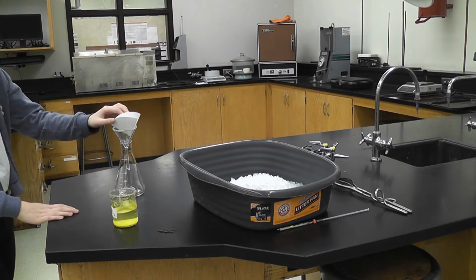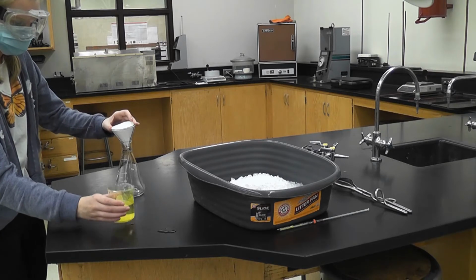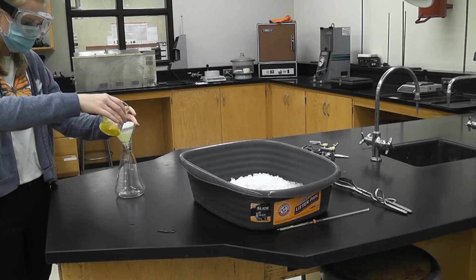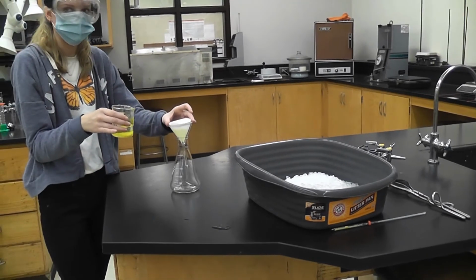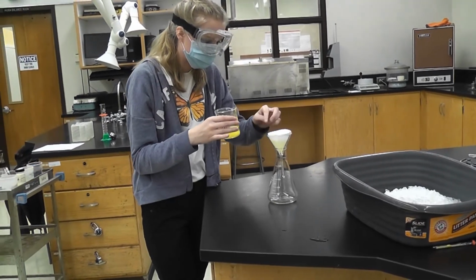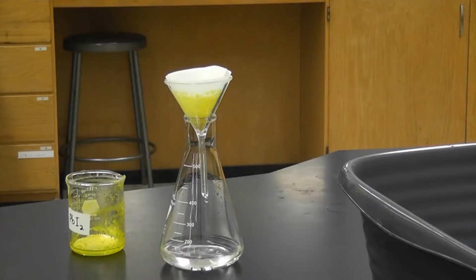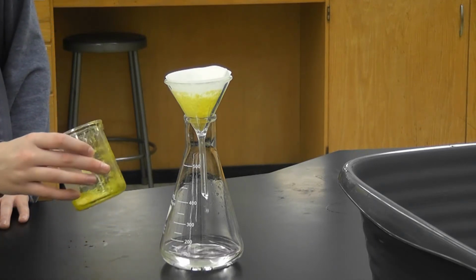Okay. So I believe now that it's at room temperature, now we want to pour it into the filter paper, so that way it catches and the liquid goes out. Okay. Gotta go slow because it has to filter out. Also, we're going to overflow it a little bit. If you were able to see up top here, you can see the crystals floating on top, and there's just water dripping out the bottom.